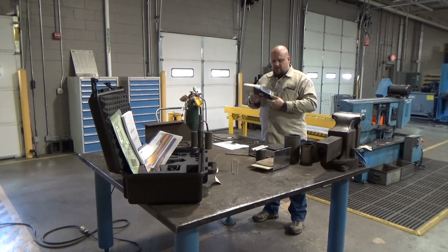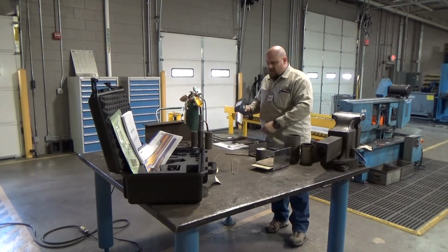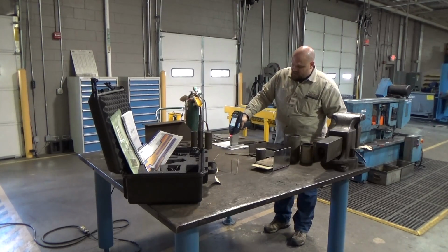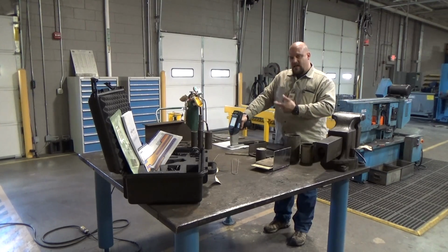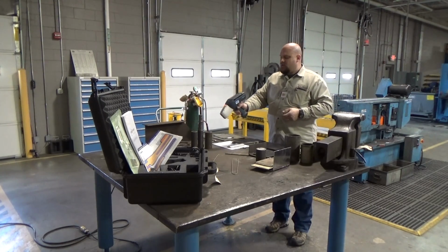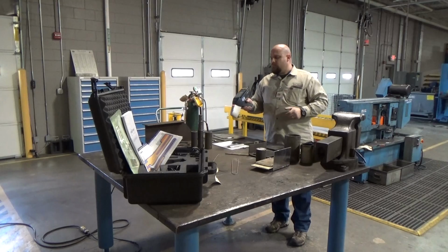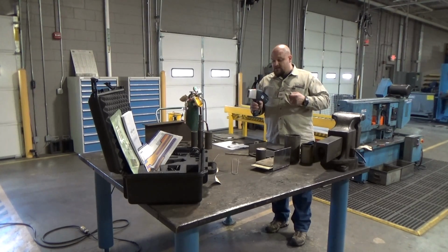So, excellent tool. Again, even though there are some limitations, those limitations have been addressed in newer models. From the literature I've read, it is now capable of reading the light elements. It doesn't have to lump them. It can separate them out so you get a much more accurate reading and better overall results, and you know exactly what you have. This material, we know it's aluminum, but it is telling us it is an alloy 5086. Okay, or that's the closest.